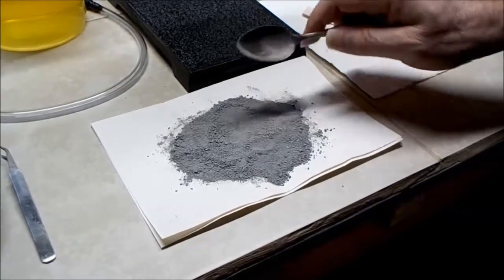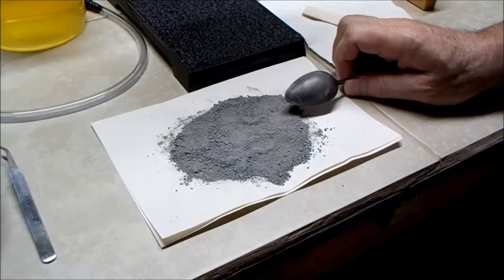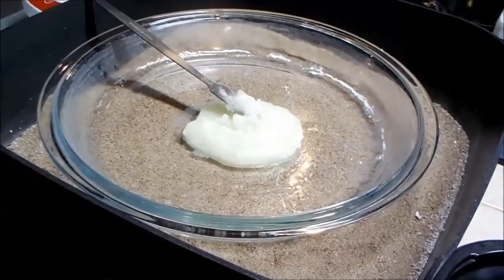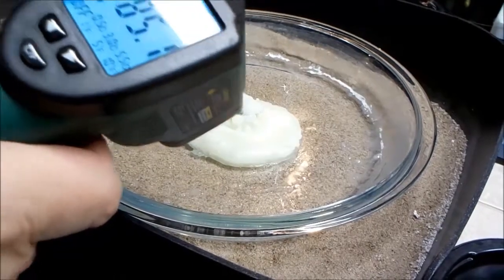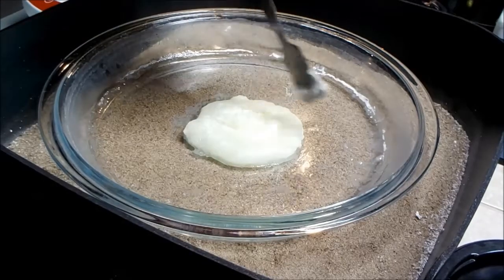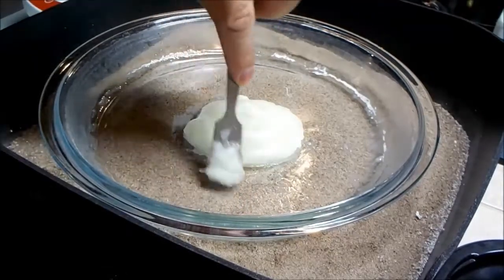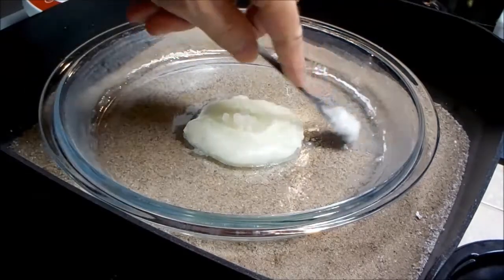I don't know what it is — it shouldn't really have any carbon left in it because I roasted it so much, but there might be some. I may try to do more with that. Back to the electric skillet for another temperature reading — it's about 84 degrees. It's hard as a rock. However, around the edges where there was just a little bit left that I didn't scrape up, it's starting to liquefy. I would assume it's pulling water right out of the air and showing its deliquescent properties.